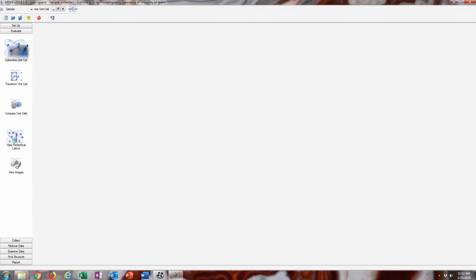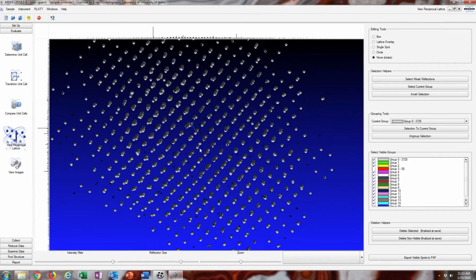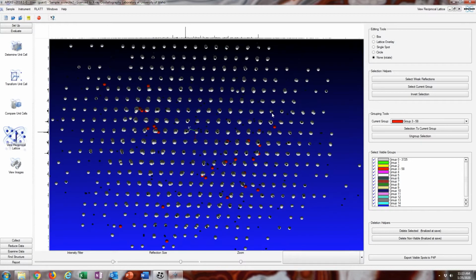There's a couple of reasons to do this. One being if you know the crystal is twinned, or there are inclusions of other crystals in it, or there's something messed up about the crystal, you could pick out the intensity maxima that correspond to the main lattice you're interested in. You could separate them out even. There's a lot of applications to this, but it's probably good practice to just solve it normally at first, and then do this hand picking.